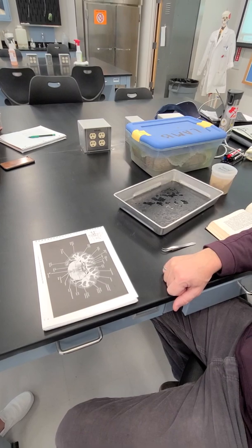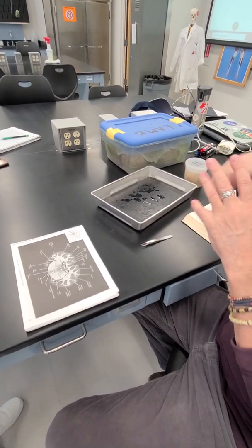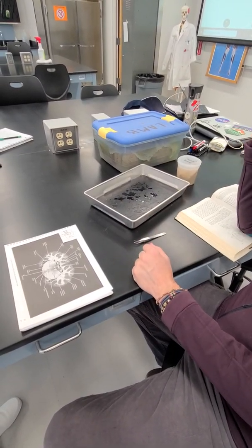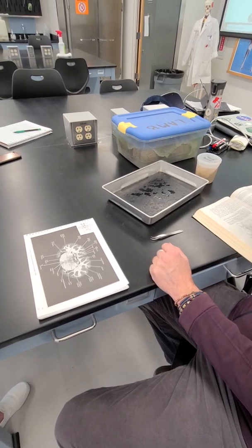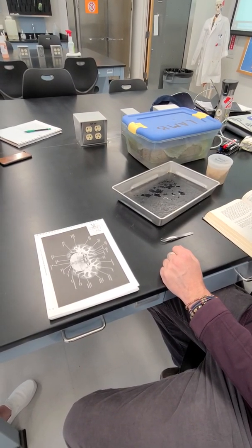The difference is, a lot of these structures and their relations are very similar. The difference is the relative sizes of these structures, especially in the cerebral hemispheres. The different lobes are very different size-wise, correlated to the type of thinking that sheep do and humans do.